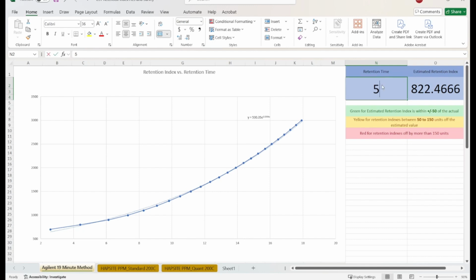My retention time was 17.1 minutes. And when I enter that in, it gives me about 2738 for my expected retention index, which happened to be very close to the true answer's retention index, confirming and increasing our confidence that it was the right answer.